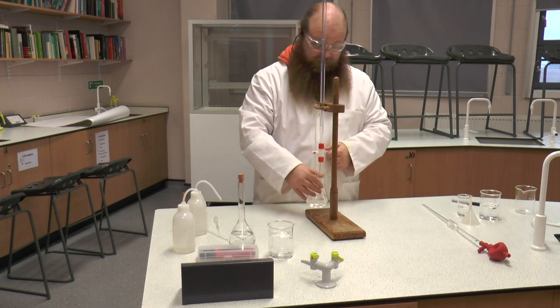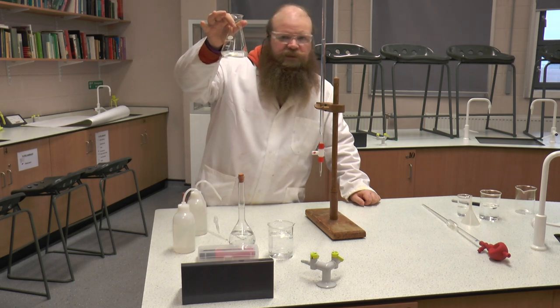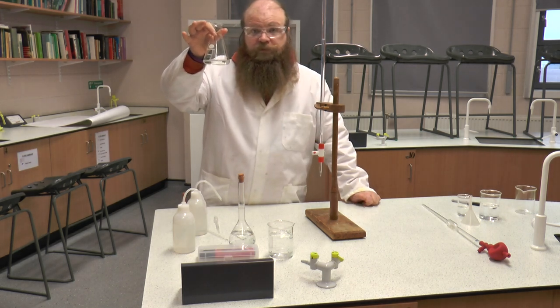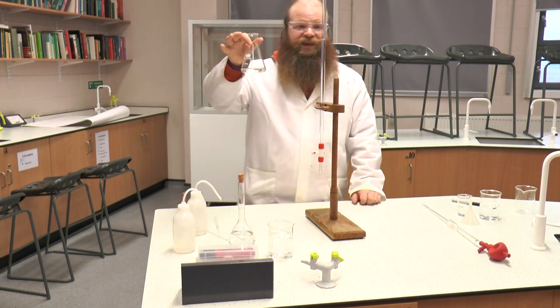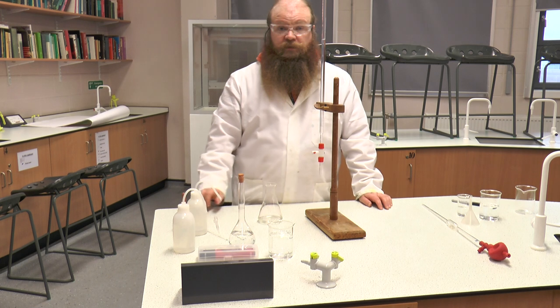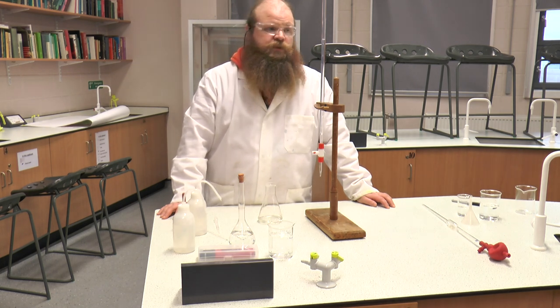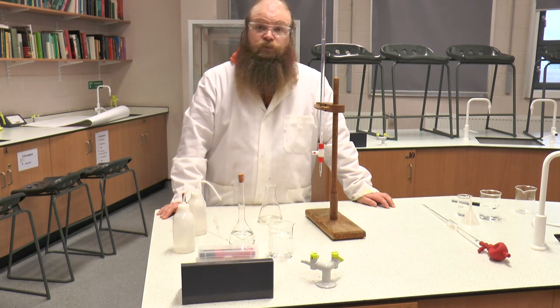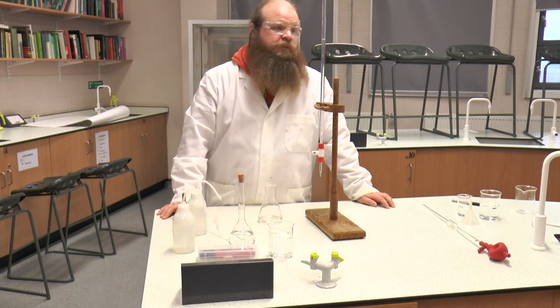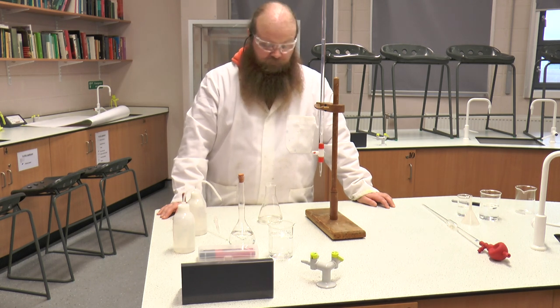I am just running a few cm³ at a time through and then pausing to allow it to mix, and then doing the same again. The solution has now gone clear at 21.1 cm³. If we take our initial reading from this final reading, we will end up with what is called a titer — the amount of fluid we have used in the reaction. Our start was 1.4 cm³ and our final was 21.1 cm³, which gives us a titer of 19.7 cm³.